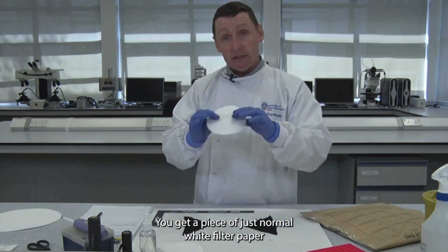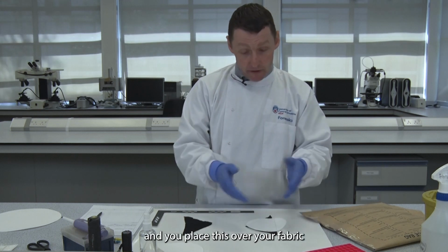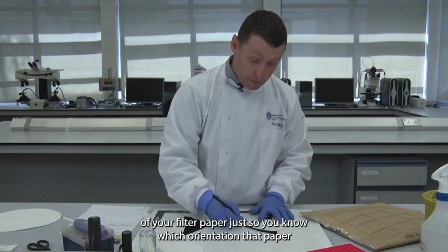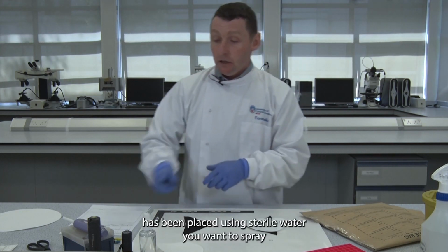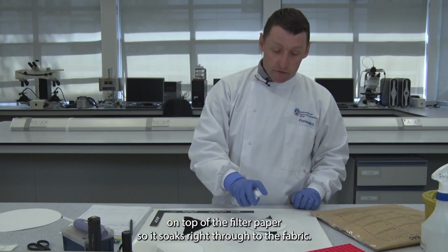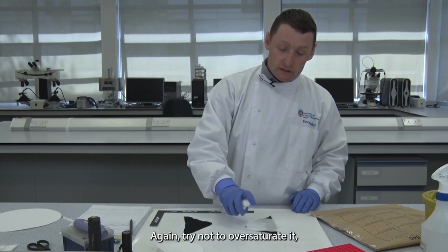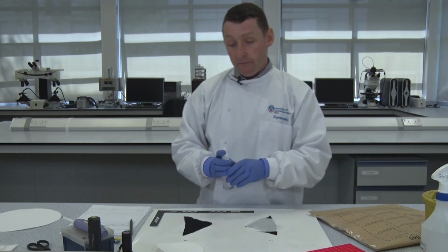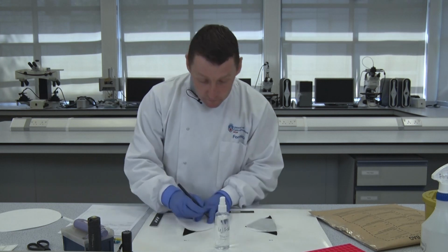To do this, you get a piece of normal white filter paper and place it over your fabric, and you can mark the edges of your filter paper so you know which orientation it has been placed. Using sterile water, you want to spray on top of the filter paper so it soaks right through to the fabric. Try not to oversaturate it, but cover the total surface area. You might want to do this with your negative control.